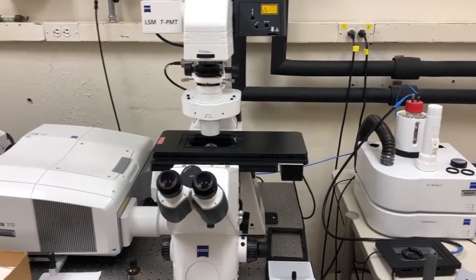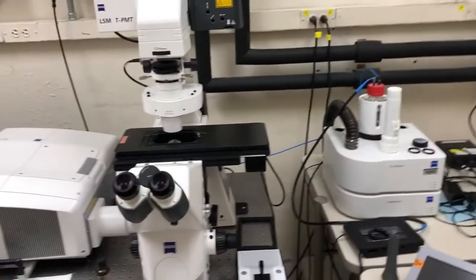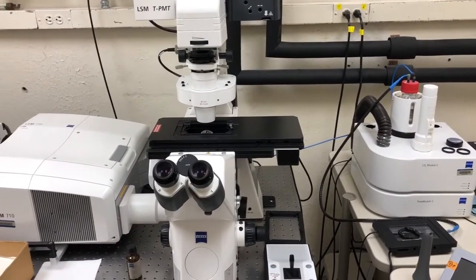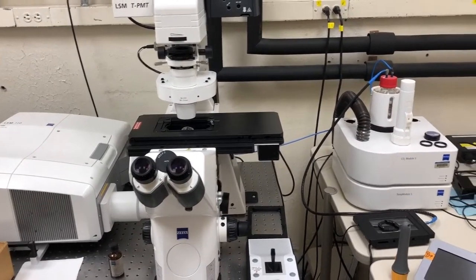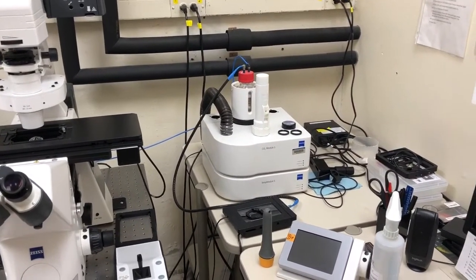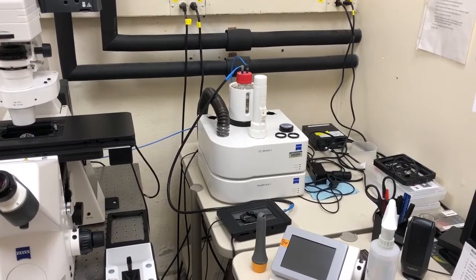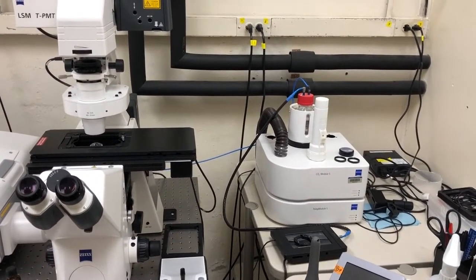Hi, this video will cover how to use the live cell incubation chamber on the Zeiss LSM710. To use that system to be able to image live cells with temperature control, humidity at a proper level, and CO2 at a proper level, there are a number of additional things we need to turn on the system.